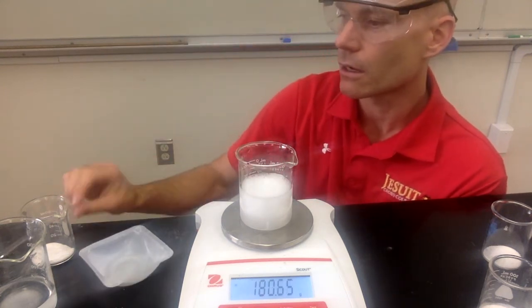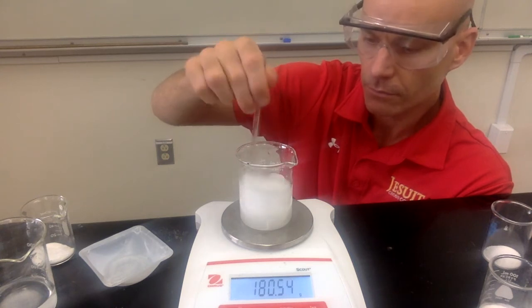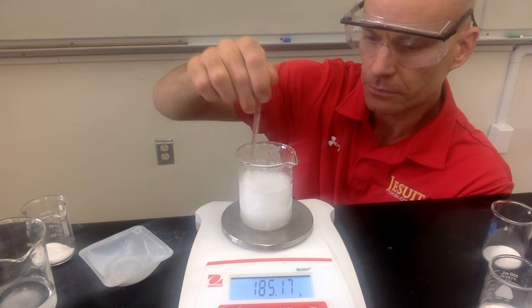All right, so we've added it all. Now we just need to stir and let it finish reacting. Let these bubbles pop.